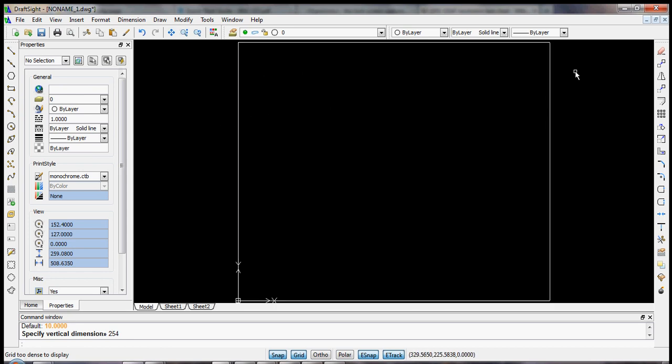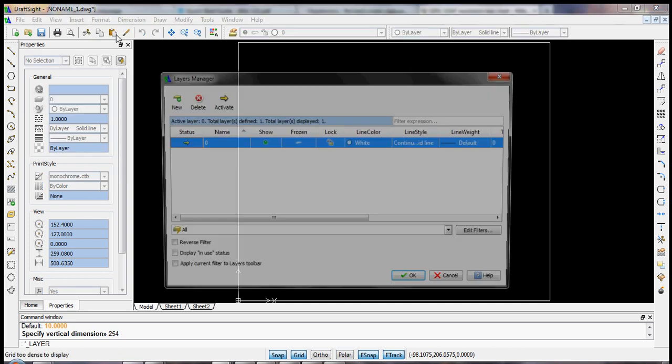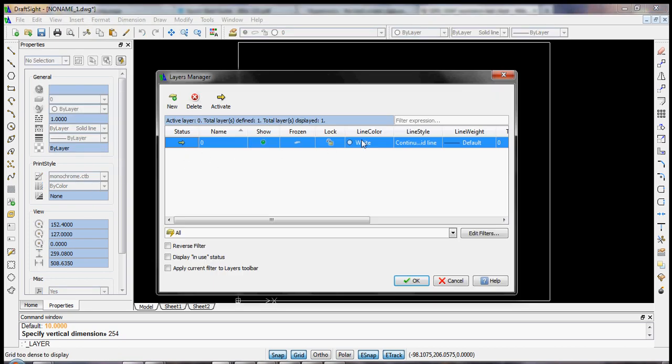And let's now think about layers. It's very useful to have a layer for construction lines and a layer for the printouts. Now we by default have a layer that's called 0. And you see the layers in this element over here under the properties. It says 0, and that's all we have right now. So let's modify these a little bit. Let's go to Format, Layer. And you see all we have for one layer.